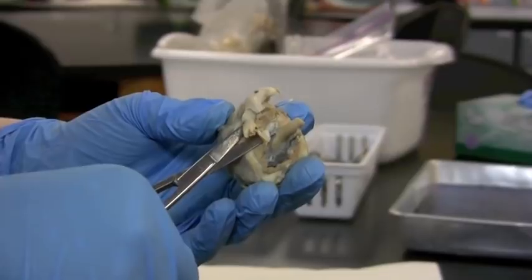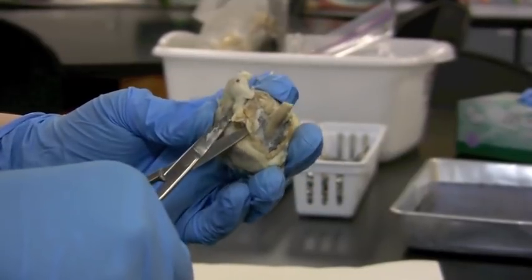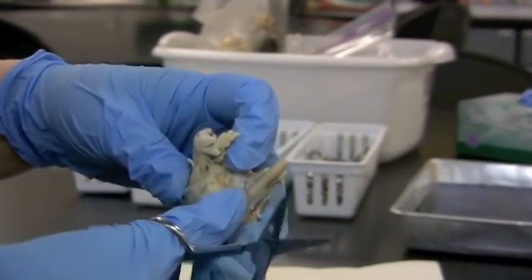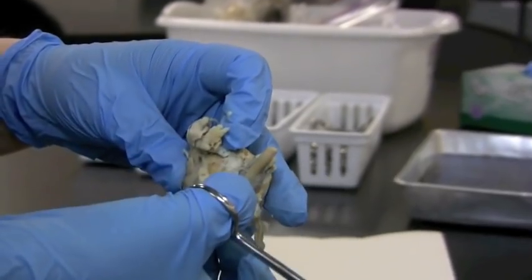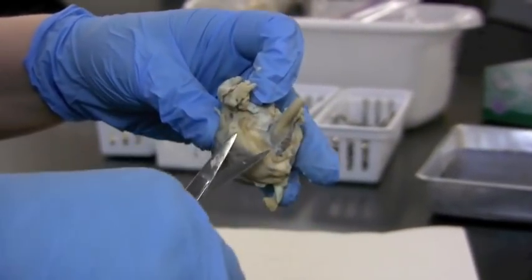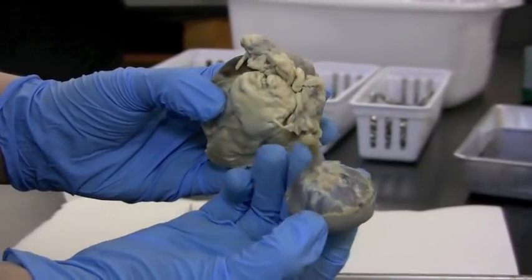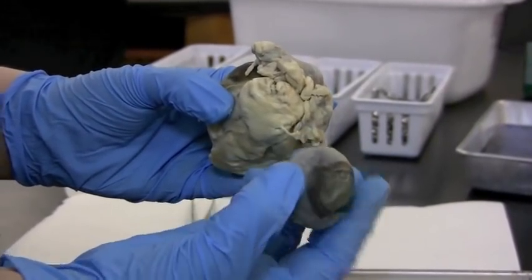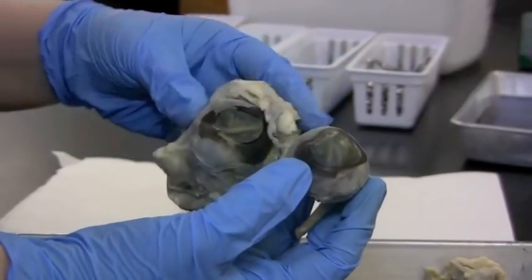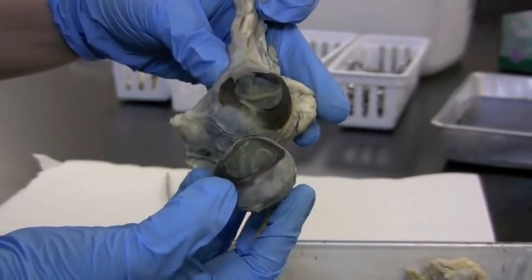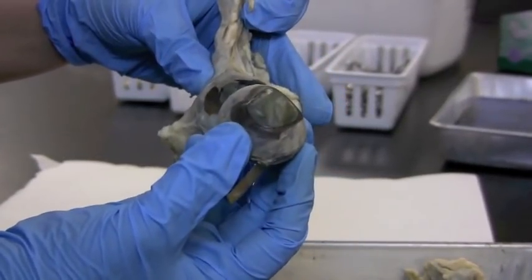So I've been chopping away, slicing for a while. Just wanted to show you this optic nerve goes right up to the eyeball. So it takes some time to get all of this tissue out of the way. I trimmed all of that away until we get to just this eyeball that's sitting inside this big hunk of tissue. And that's what we're going to work with now.